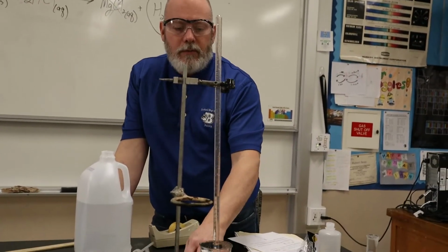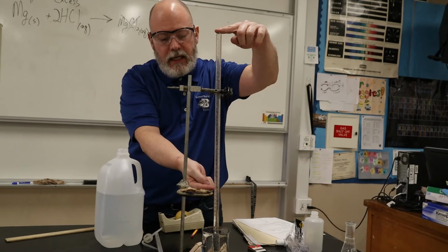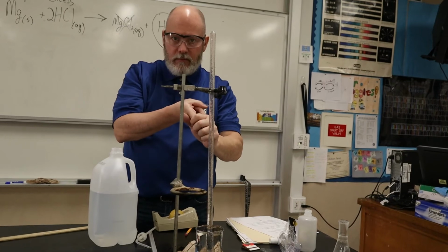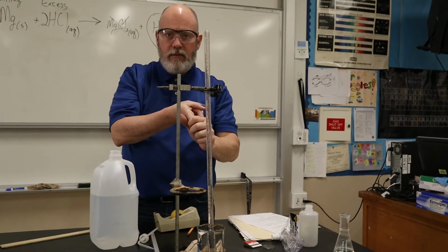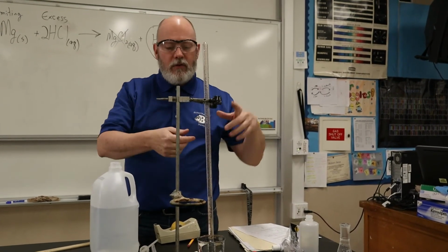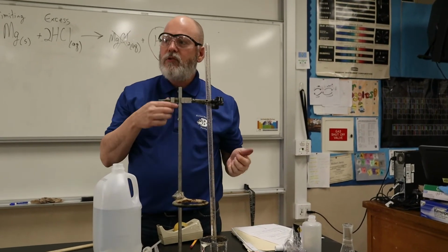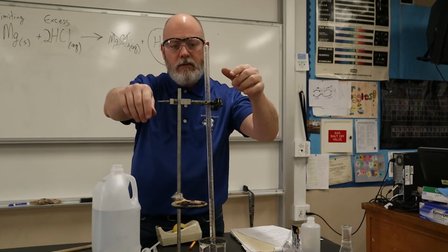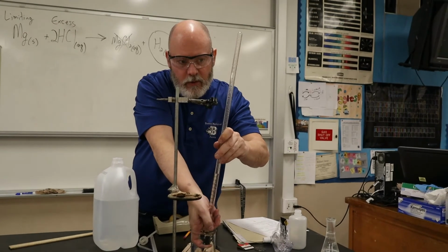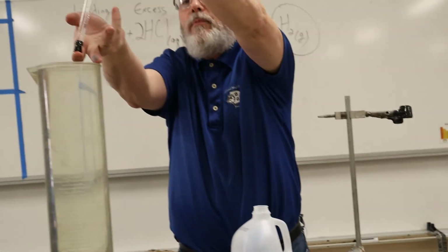Okay, so here's what we're gonna do. Now, we need to collect the volume of the hydrogen gas. We need to collect the temperature and the pressure, right? So we can do the ideal gas equation because we're gonna solve for n, which is moles. Okay, so the volume we're gonna read here, but how are we gonna get the pressure? I can't stick a pressure gauge in here. So what we're gonna do is, now watch this, okay? I'm gonna take the eudiometer, I'm gonna put my finger over the hole so no air gets in there, and I'm gonna transfer it to this big guy right here.